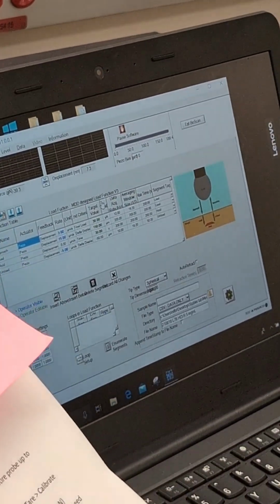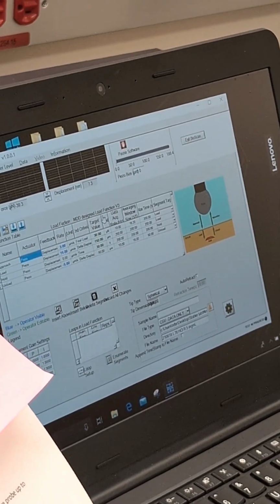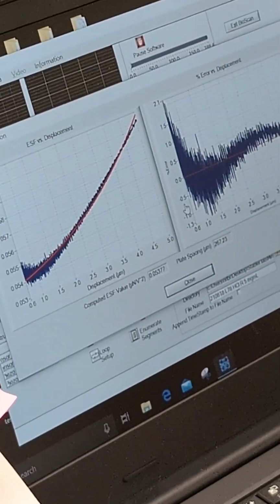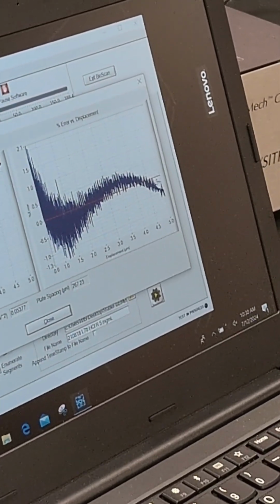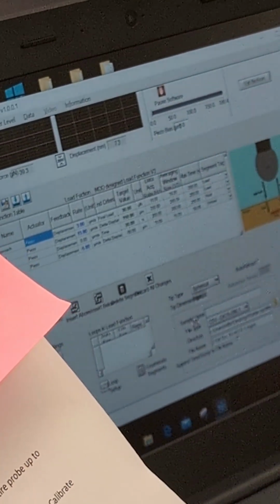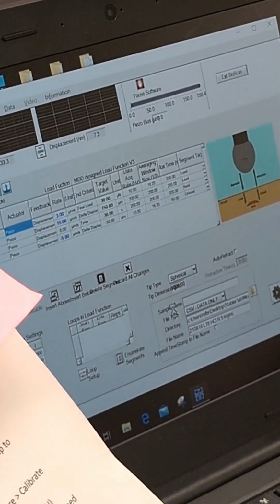And then it will generate a report telling you what the magnitude of the noise is. So you want to see, show me detail. And you can see that as it tries to calibrate itself, the percentage of the error becomes smaller and smaller. If you hit close, it will generate a report to show you. What's it pop up?